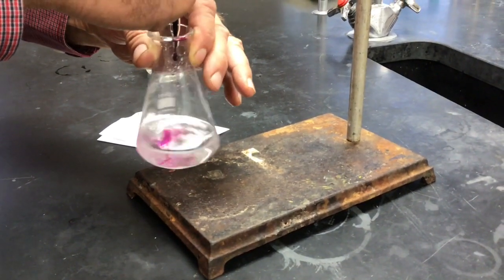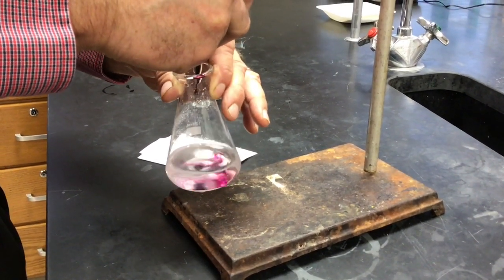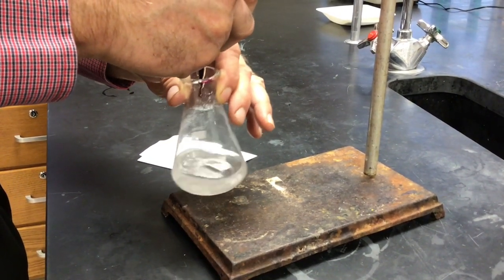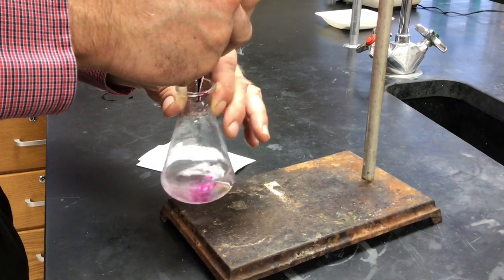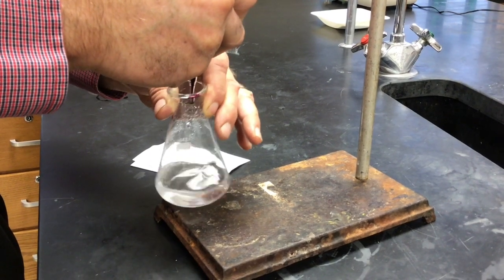We're going drop by drop. You are. I'm trying to go drop by drop. Pink's hanging around longer.